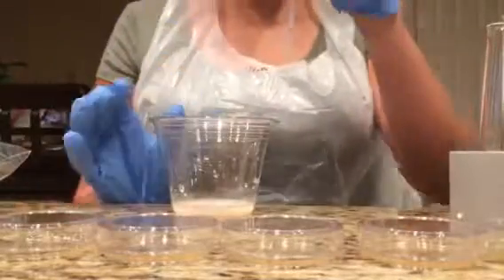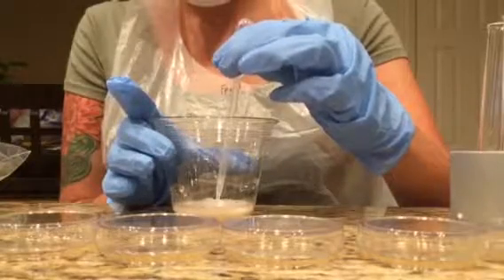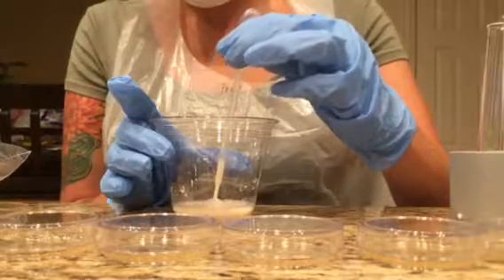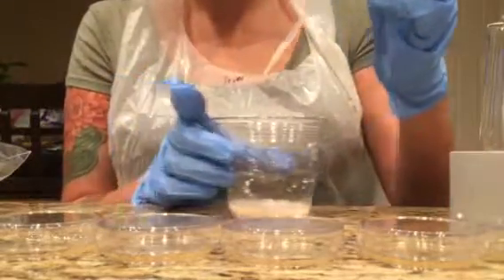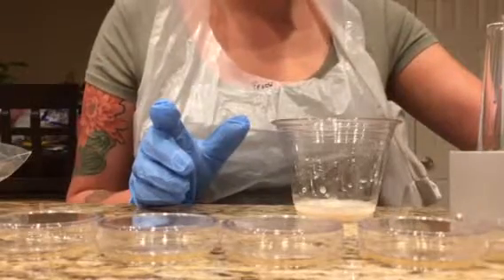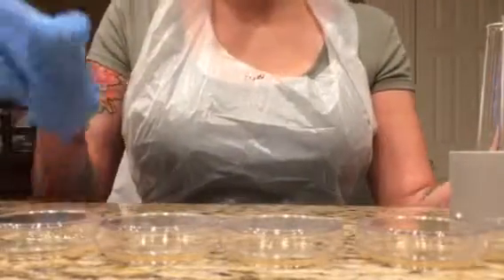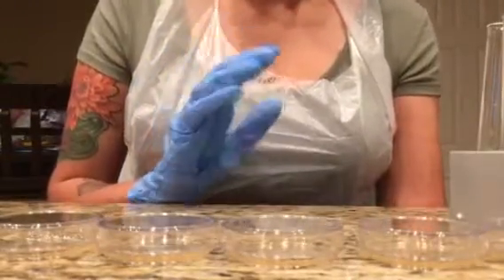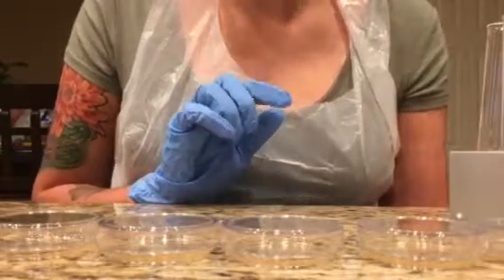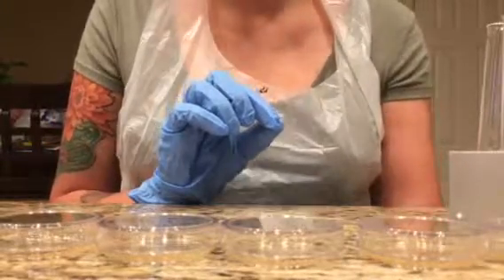So I have my pipette here. I will be going up to 0.25. And then I will be putting this into the first test tube. Okay, so from there I have the first test tube already filled with the yeast solution. From there it asks for me to pipette the solution up and down several times to ensure all organisms are rinsed from the pipette into the test tube.